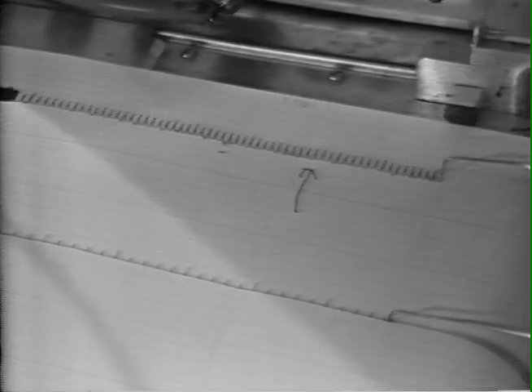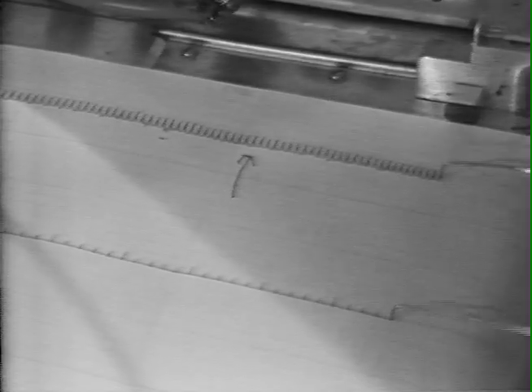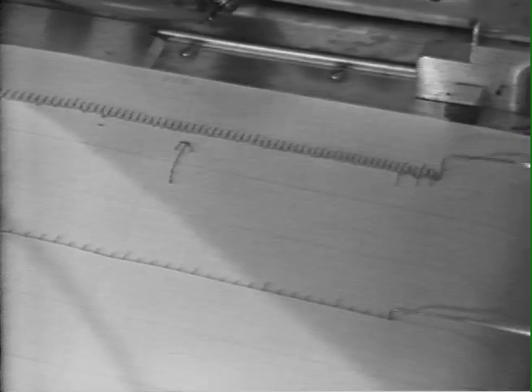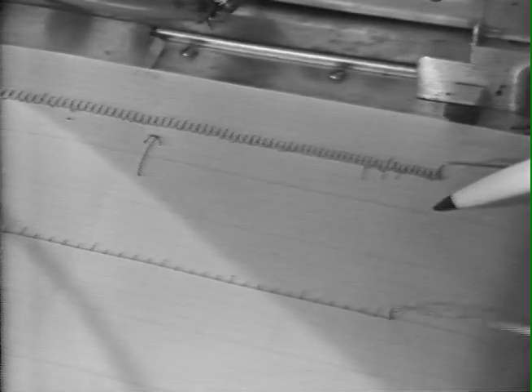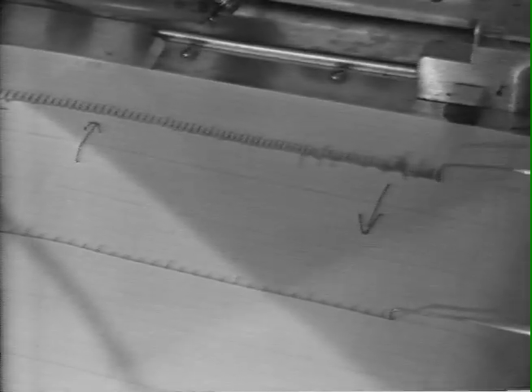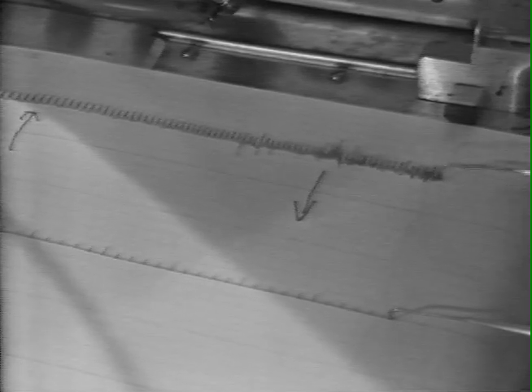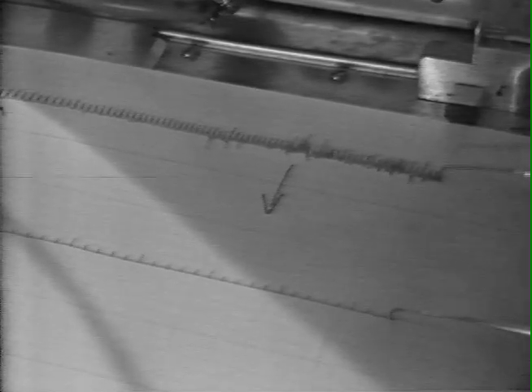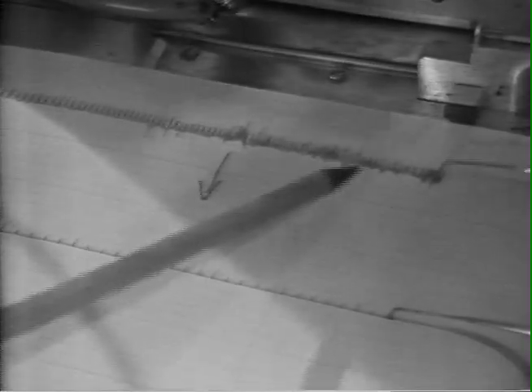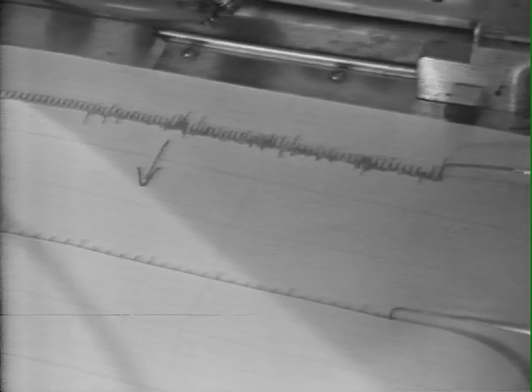This time we can expect to see a more rapid onset of the rate response, and in fact it is increasing. There's little change in the force of contraction. All right, the stimulation is now off, and we will see how rapidly it returns back to its baseline. We can see at this frequency arrhythmias are being maintained, although they are beginning to lapse back into a more normal rhythm slowly.